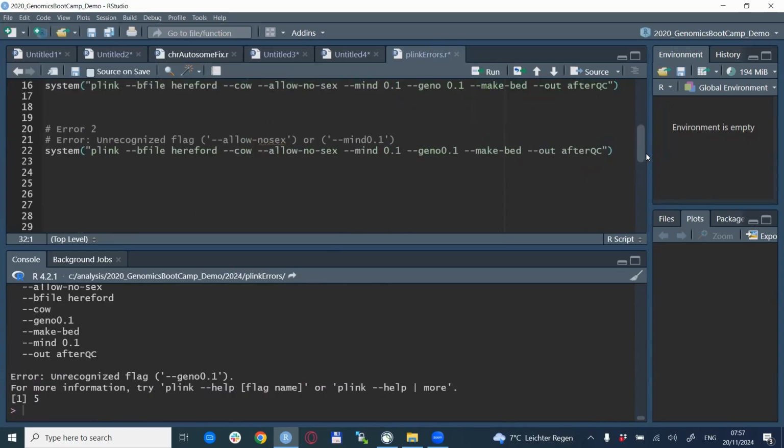So if you see an unrecognized flag error message, then it's most likely a typo or something missing in your line that prevents PLINK from running it correctly. If you get this, you look very closely at the option that is displayed to you, and it will most likely be the source of the error.